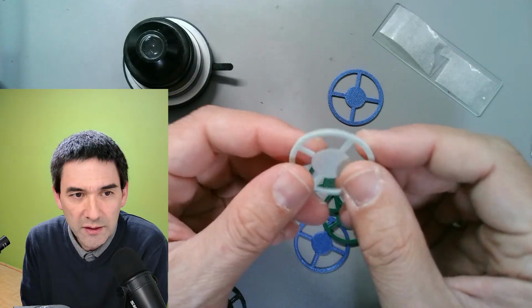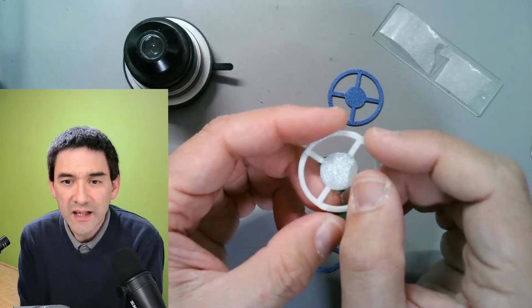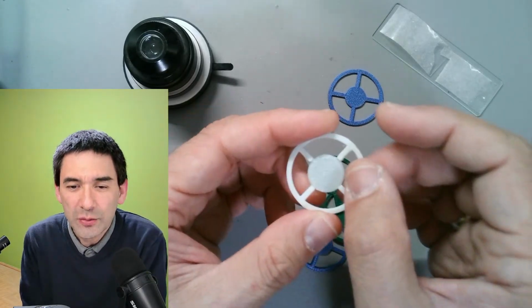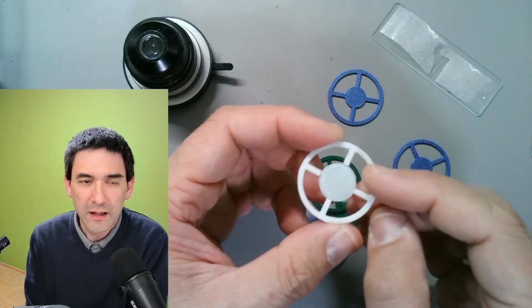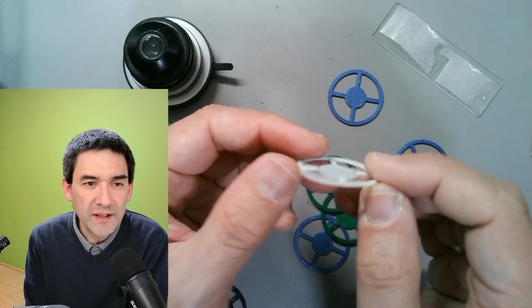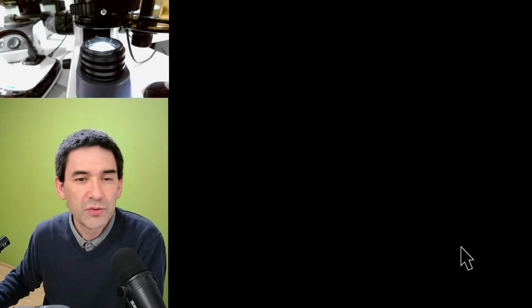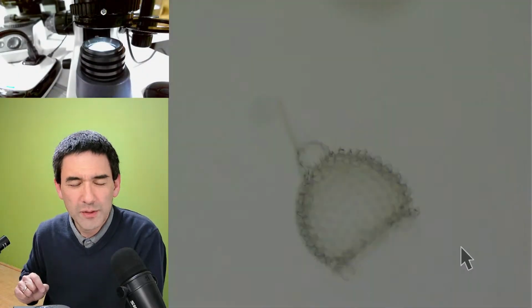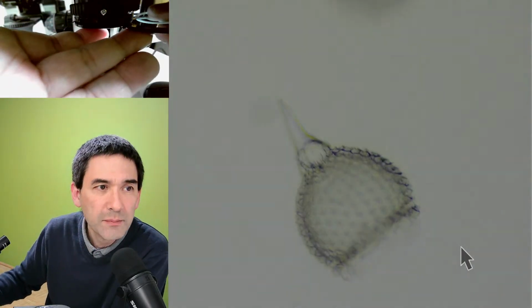And now let's have a look at this one over here. You should do it with Christiansen illumination. I still have to read into that. I've heard about this, but I'd have to read a little bit more to do a video on this. So let's try this one over here, which I printed just today in the afternoon. It always takes a little bit of time. Let's put it in here.